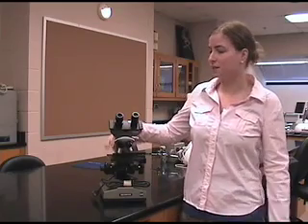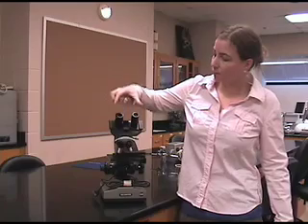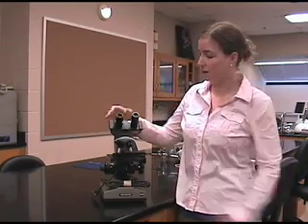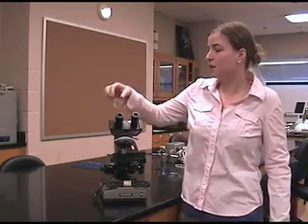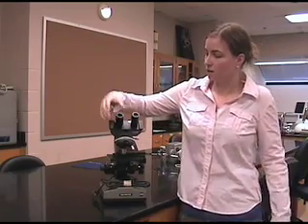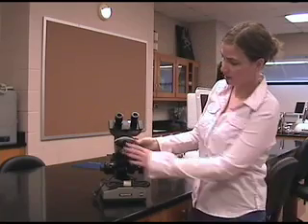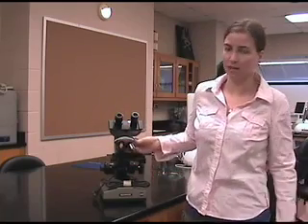It's called a binocular compound microscope for two reasons. First, there are two eyepieces or ocular lenses, hence why it's called binocular. And it's also compound because there are two sets of lenses — the ocular lenses as well as the lenses below called the objective lenses.